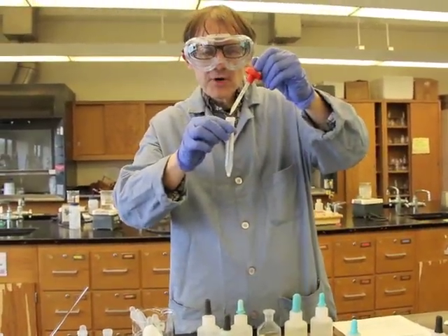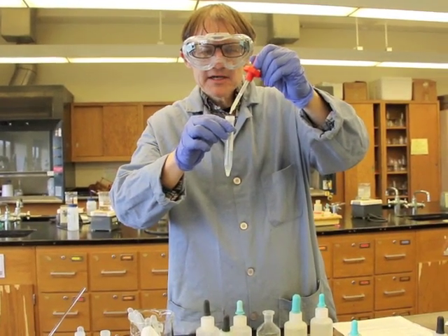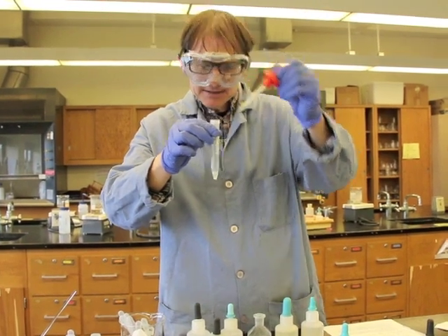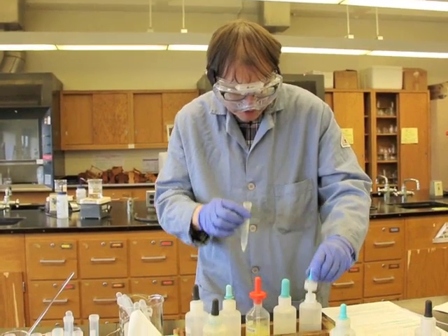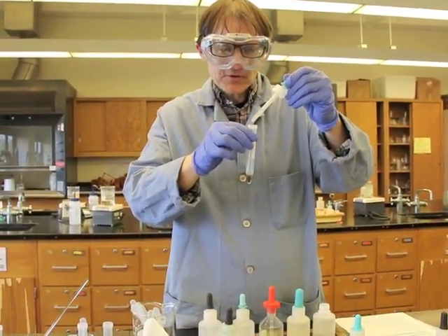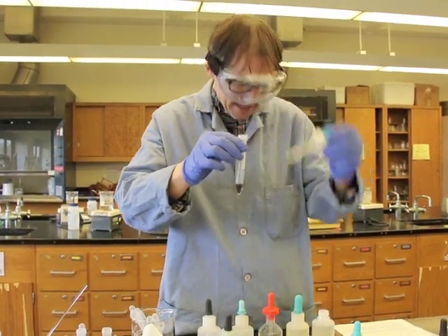So 1, 2, 3, 4, 5, 6, 7, 8, 9, and 10. And then the 10 drops of sodium hydroxide. 1, 2, 3, 4, 5, 6, 7, 8, 9, and 10.